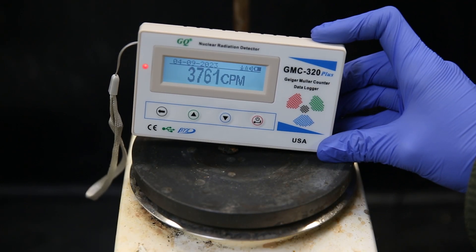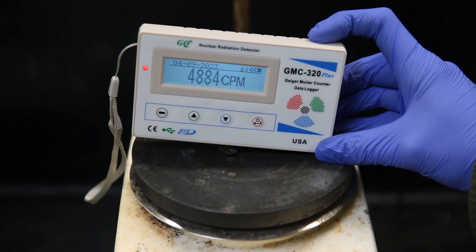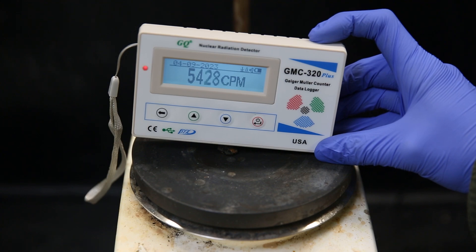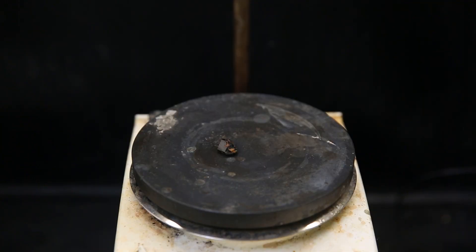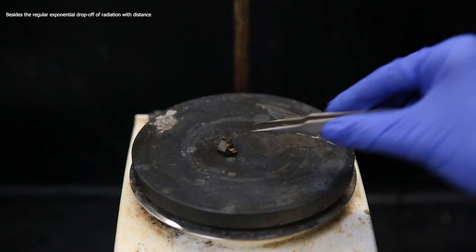So we see the rock is pretty radioactive. But in reality it might be twice as radioactive or even more if you could measure the alpha particles. Since beta radiation does not penetrate very well through material, it has to be measured quite closely. And since there is barely gamma radiation let off, the measured radiation level decreases very quickly with distance and with material in between.